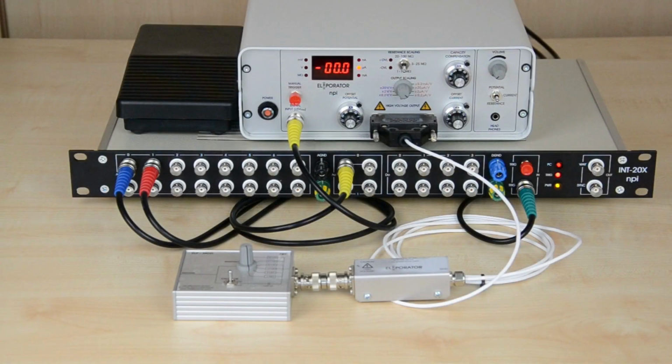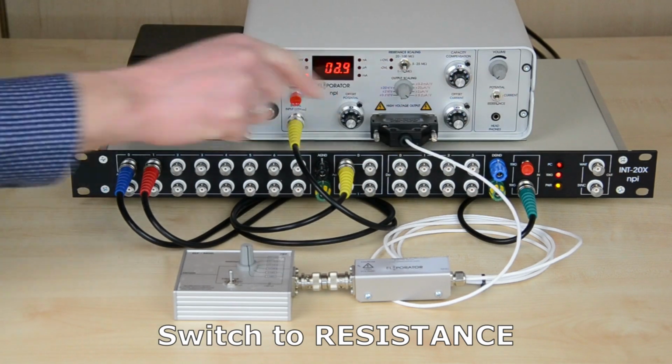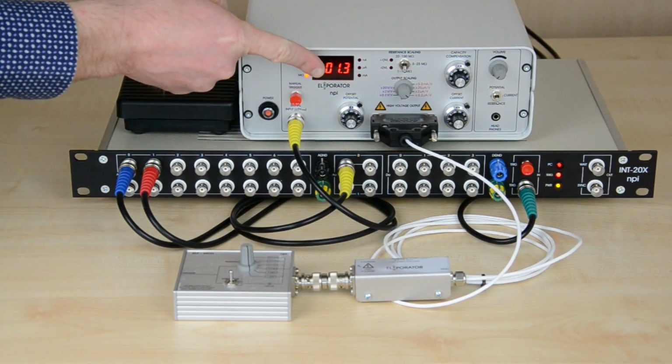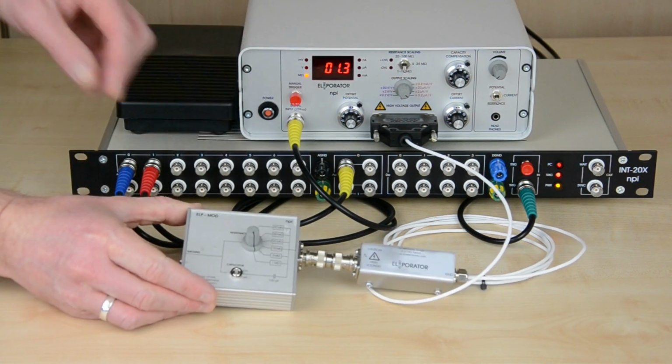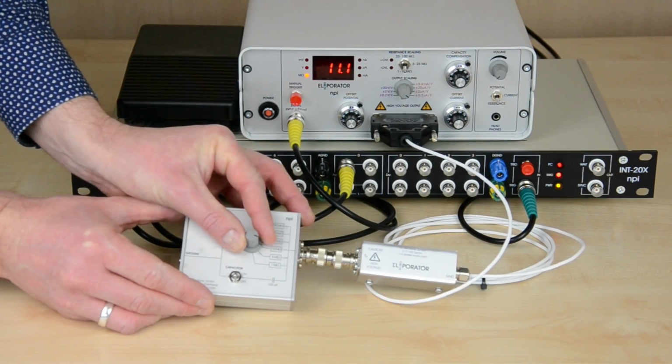To measure electrode resistances with the electroporator, set the switch on the right side of the front panel to resistance. A series of small voltage pulses will be applied to the head stage output to measure the resistance of the connected electrode. The value of the measured resistance is shown on the display. Changing the resistances in the model cell will change the reading at the display.